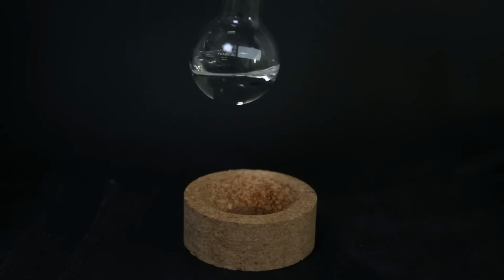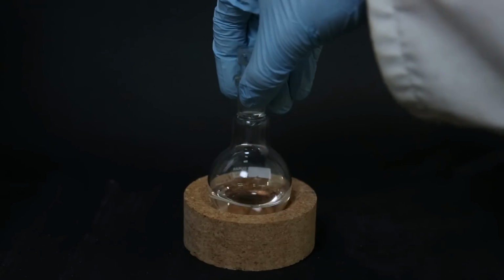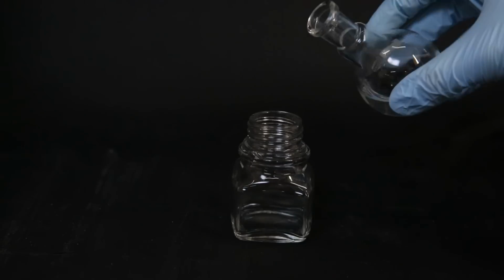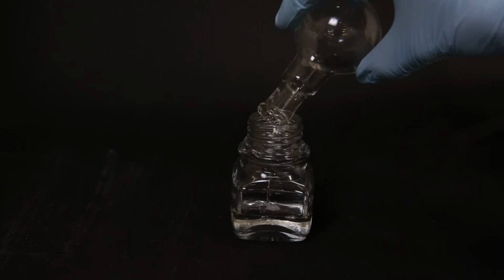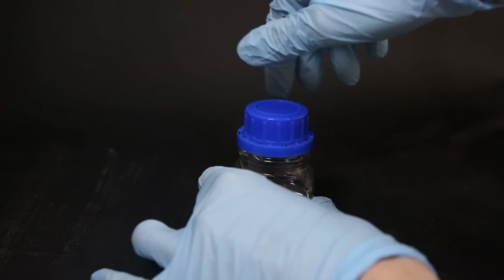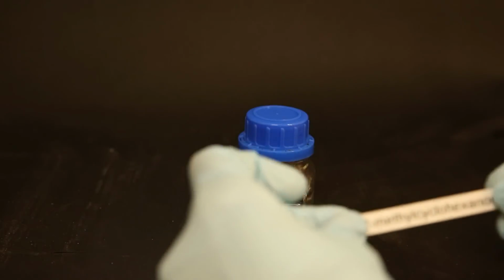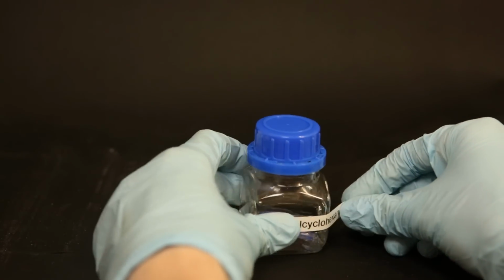I thought it smelled faintly of peppermint, and when I asked my dad to smell it, he said it smelled a bit acetone with a bit of peppermint, which funnily enough is exactly what is said online. So I'm fairly certain that I at least have my product here and not something else. Before I will use it for another project, I will likely redistill it and dry it on molecular sieves. For now, I will store it in a small container and use it when I need to.